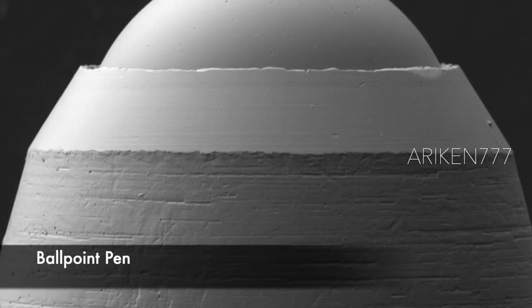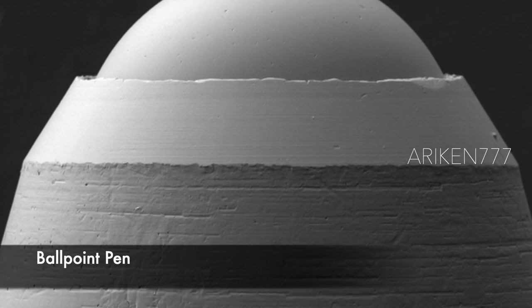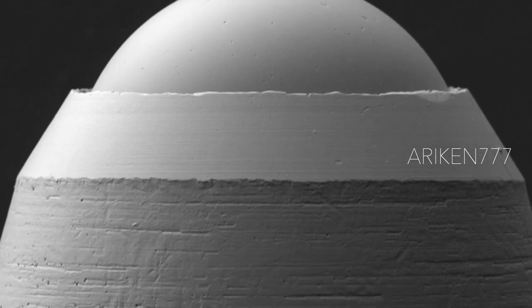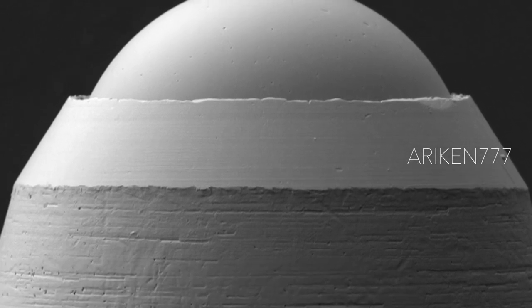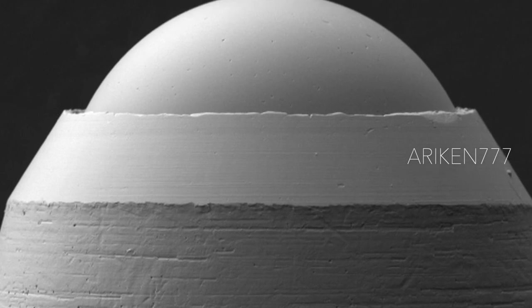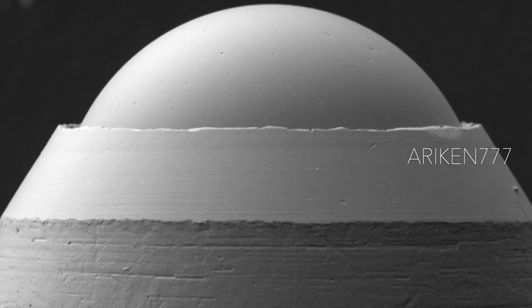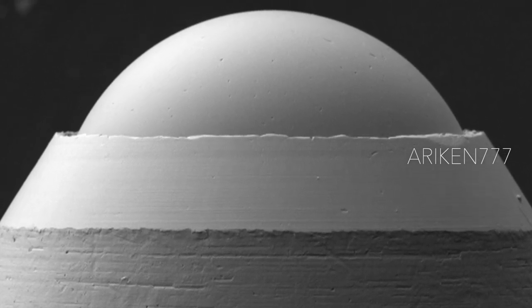Nib of a ballpoint pen. Ballpoint pens have an internal chamber filled with a viscous ink that is dispensed at the tip during use by the rolling action of a small metal sphere.